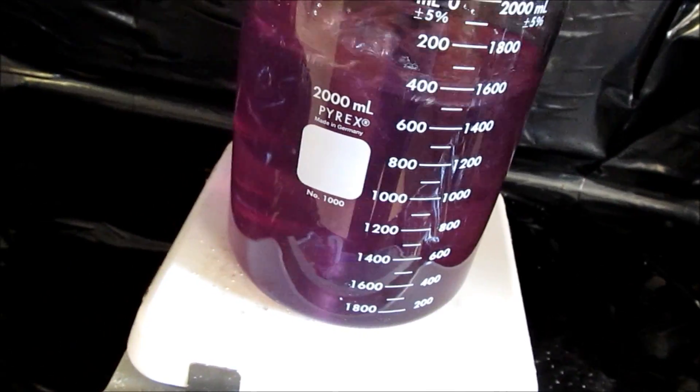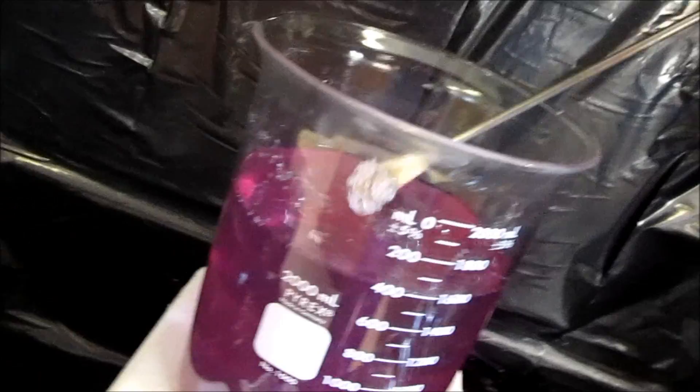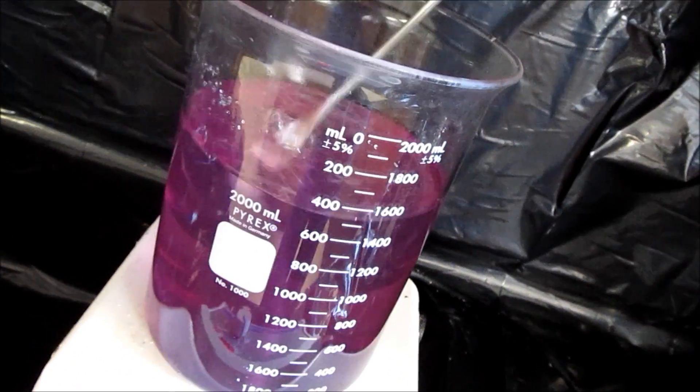Almost there. As you can see, now I've got to stir it until I get this stuff. It's real sticky right now. It's almost off.